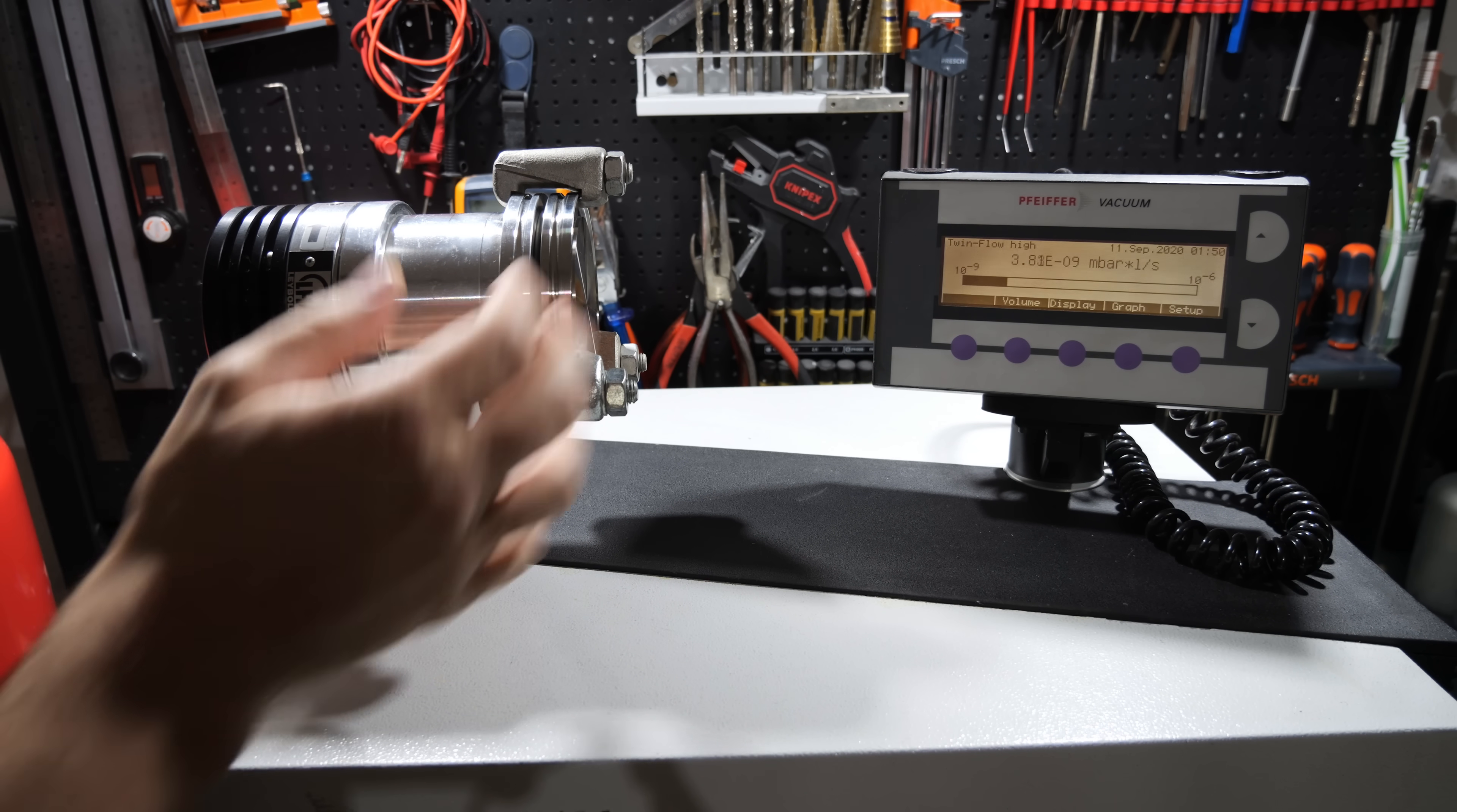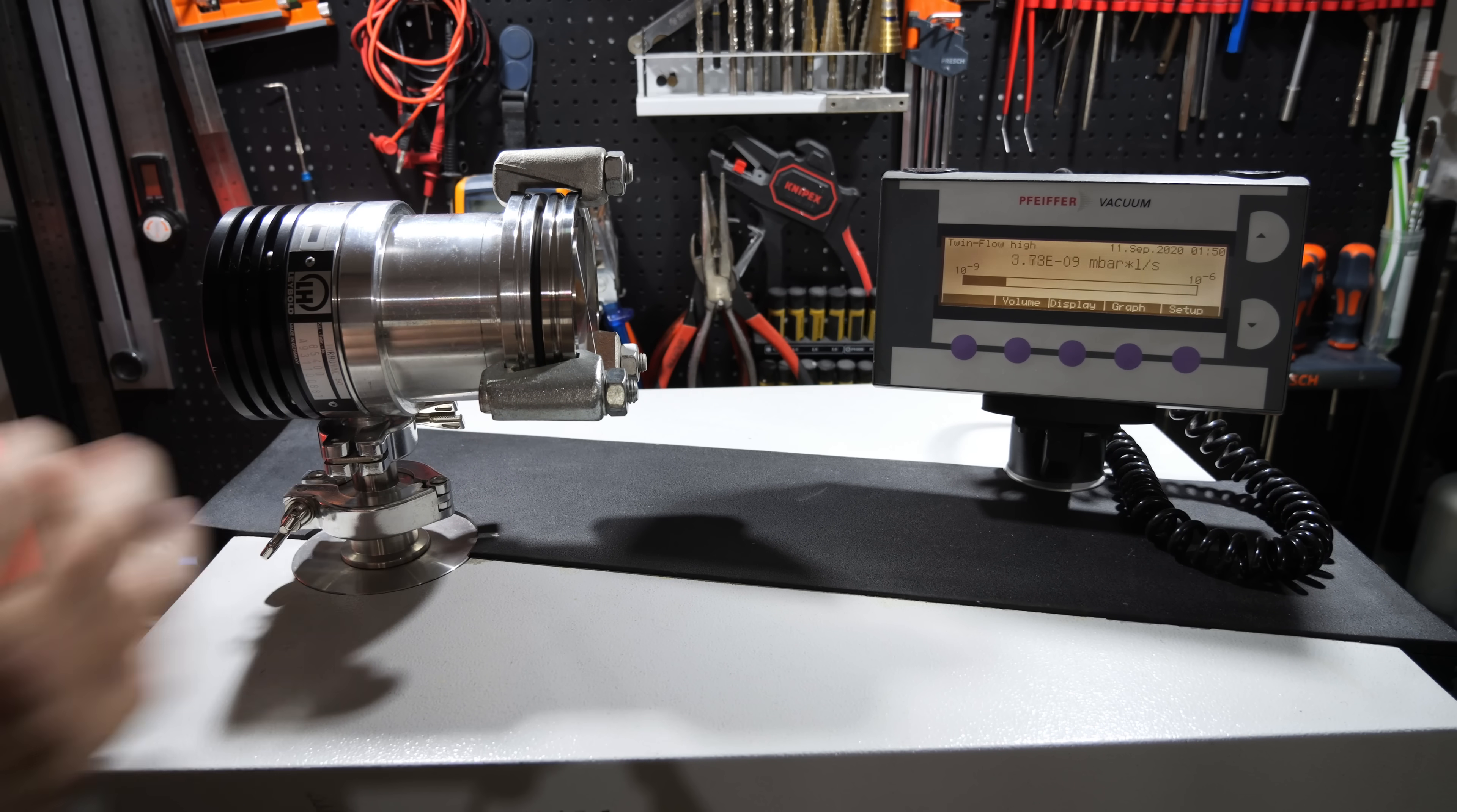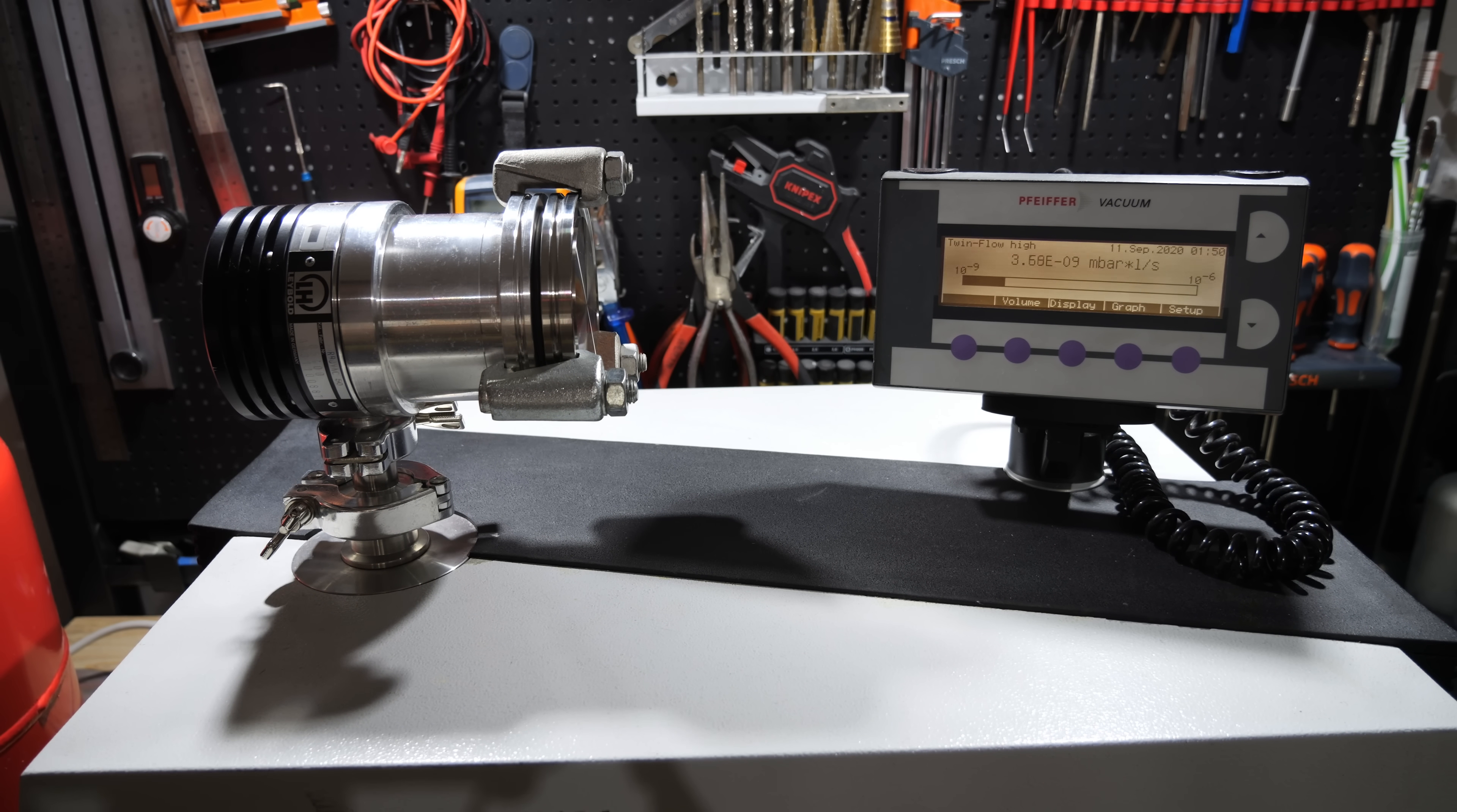That looks great. I can't see any leaks. So I think we're ready to spin this turbo up.